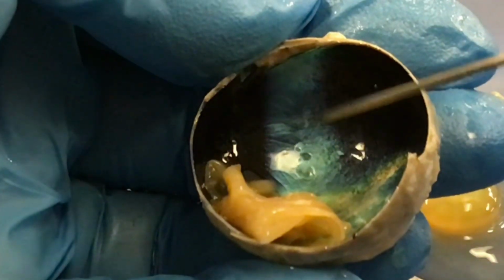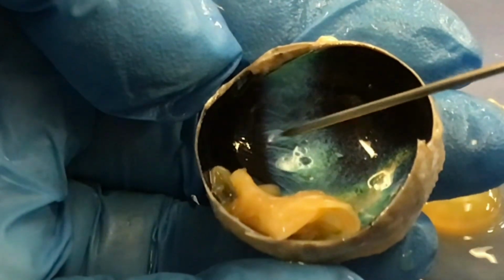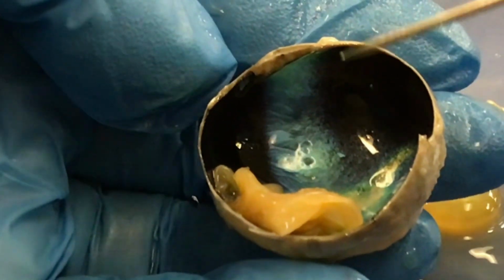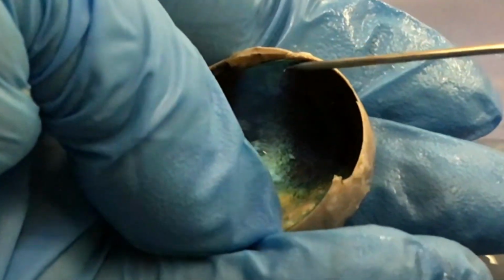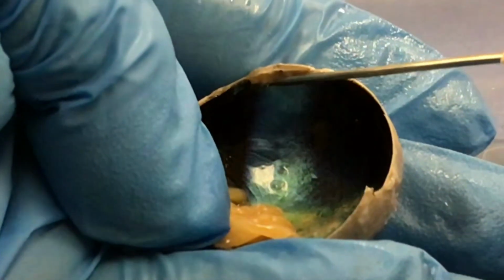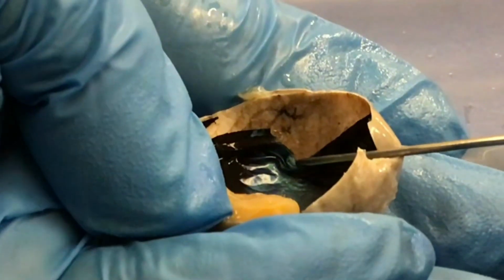These are animals that have to be able to see in low light level situations, and the tapetum lucidum helps to scatter the light in the eyeball, which is going to help the animal see in the dark, night vision. It's responsible for night vision. It looks like mirrors. When you're looking at animals like dogs and cats, it'll look like a mirror shining back at you. Okay, now if we pull this down a little bit, you can see the sclera back there.